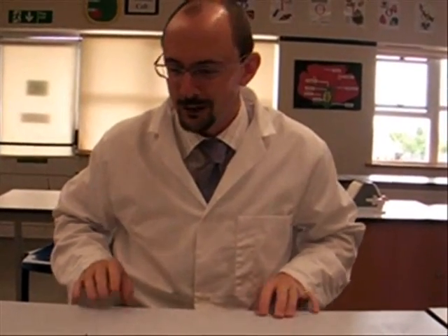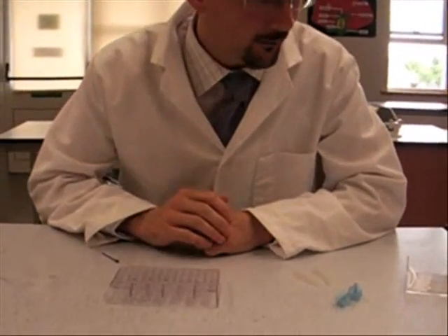Okay, so you're about to get hands-on with a bit of micro-science and the first thing to do before you get started is treat it like something from Ikea. You've got to get all your bits out first and make sure you know exactly what you need and what you don't need.